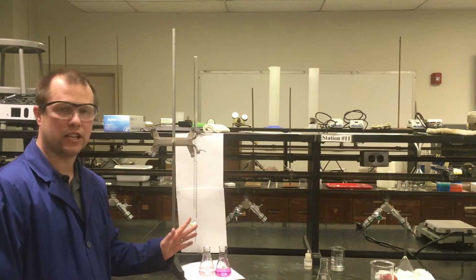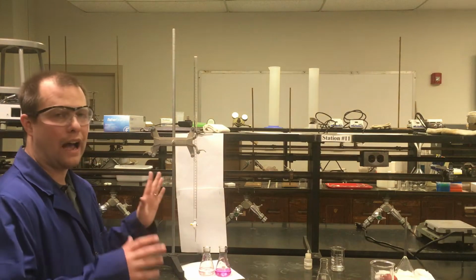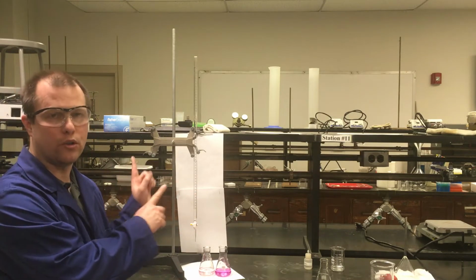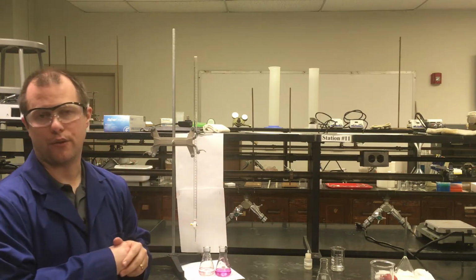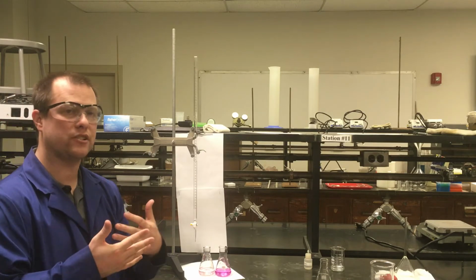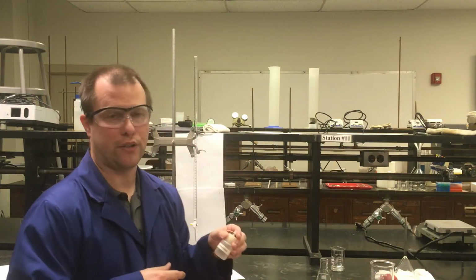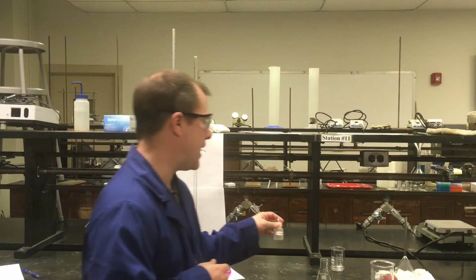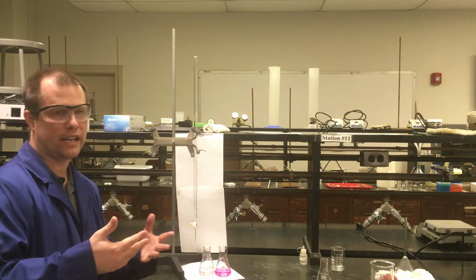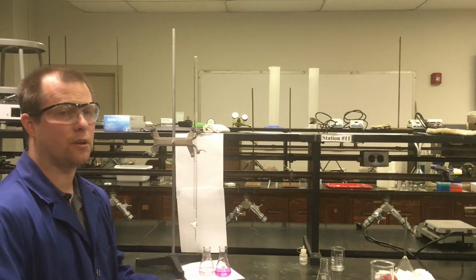Last thing I'll point out here for titrations before I get into demonstrating anything. Our goal, and how we know a titration is done and how we know the moles of our base and the moles of our acid that are reacting are the same, is to typically use something that's going to give a visual color change called an indicator. In this case, that indicator is going to be something called phenolphthalein. So phenolphthalein is a compound that once there's an excess of base in solution, so basically at any kind of basic pH, especially around 10 or so, then the solution will start to turn a dark pink, purple color.